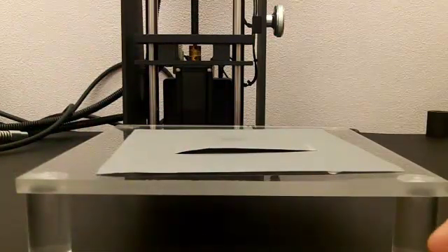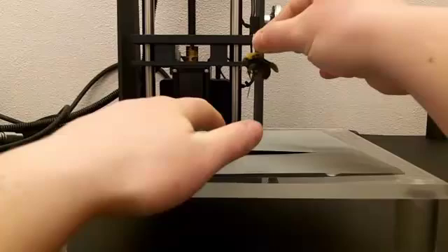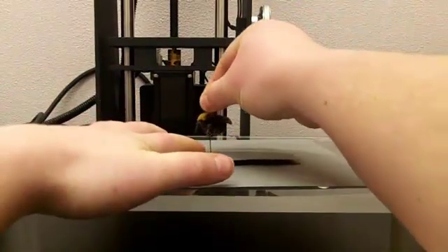Next, you take your specimen and you stick the pin into the wax.